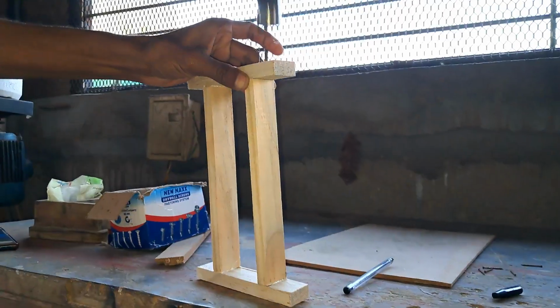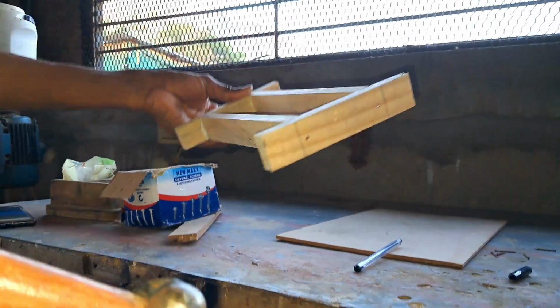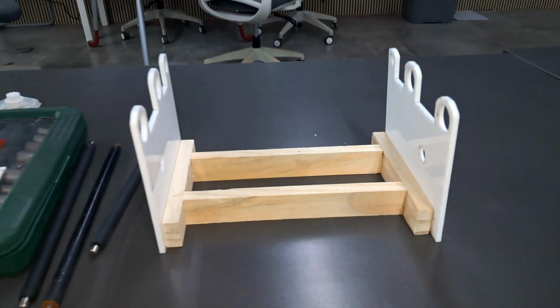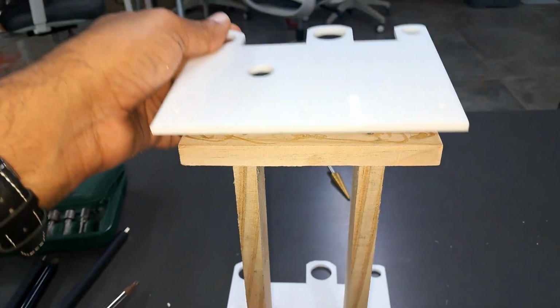So now we can place our supports on this frame. I had already made the holes on the acrylic sheets, and now we have to drill a hole on the base.